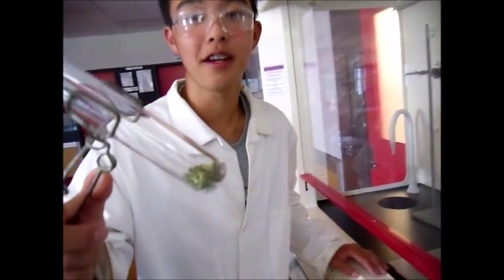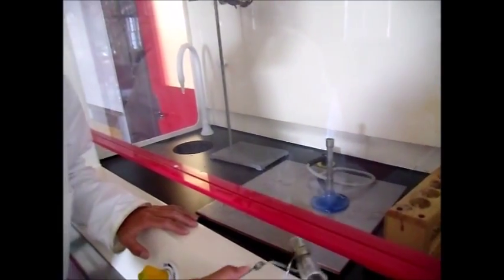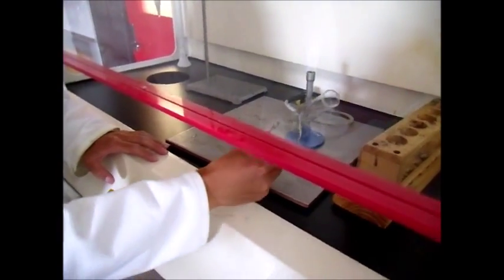So currently, I've got this test tube with the iron and sulfur mixture. I'm about to burn it in a hot blue flame. However, sulfur gas will be produced, so it's safest to do so in a fume cupboard.